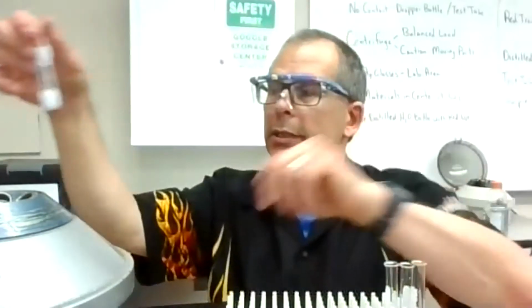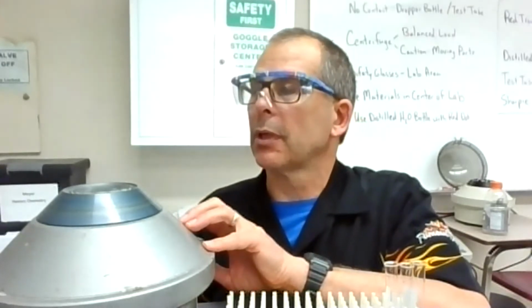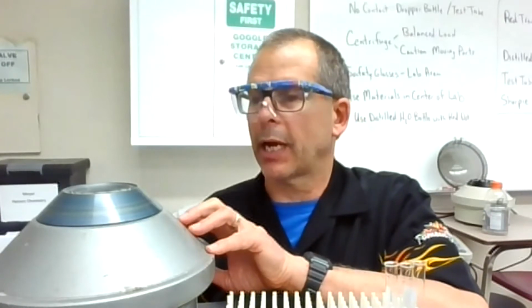And then I'm going to put it in the centrifuge, which I don't know if you can see here. Get that a little bit closer. I have another test tube in there so it's balanced. And I'm going to give that a spin. That thing spins around at probably 500, maybe even 1,000 revolutions per minute. The heavier things go to the outside. So if you went on a ride that spins at Valley Fair, you're going to be going to the outside with a centrifugal force. That way we can separate the precipitate and whatever ions are in that solid from the rest of the solution.